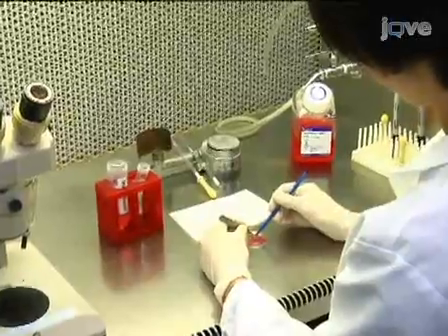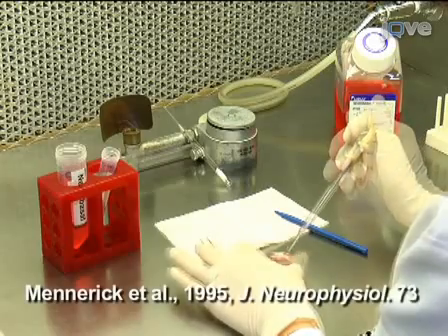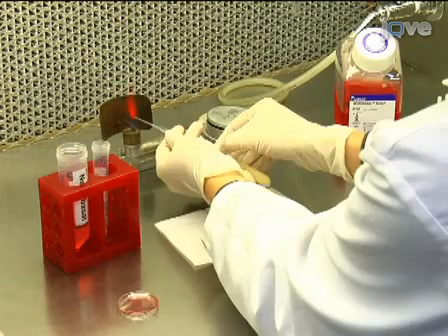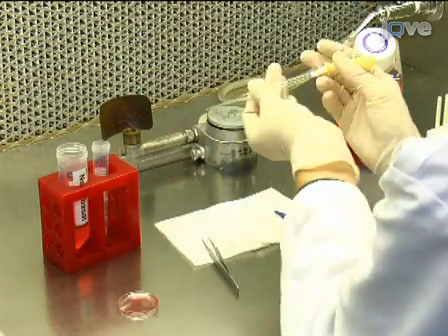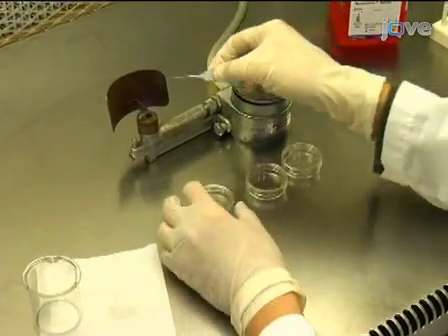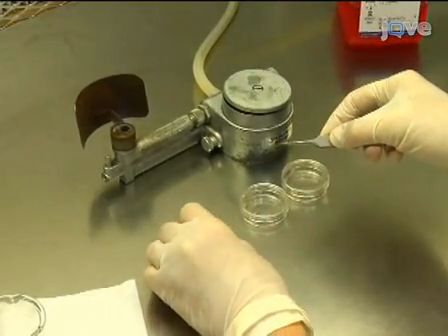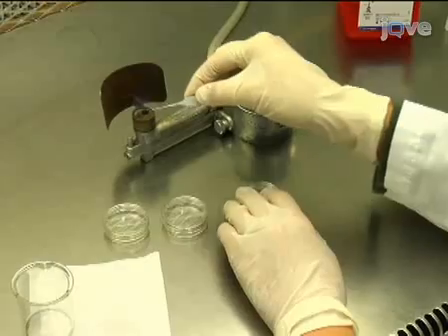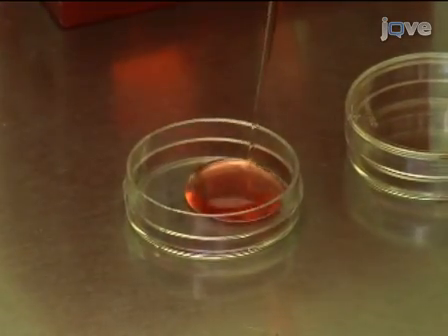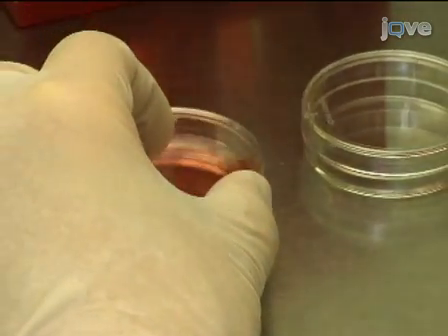In a sterile laminar flow hood, use hippocampi from postnatal day 0 to 3 rats or mice to prepare dissociated cell cultures according to our published protocol. Our cultures are mixed neuronal glial cultures derived from the same dissection. Cells should be plated in sterile 35 mm dishes, each containing a number 0 cover slip that was coated with 5 mg per milliliter of collagen. Plate the neurons at an approximate density of 500 cells per centimeter squared. 12 rat pups will typically yield 30 35 mm dishes.